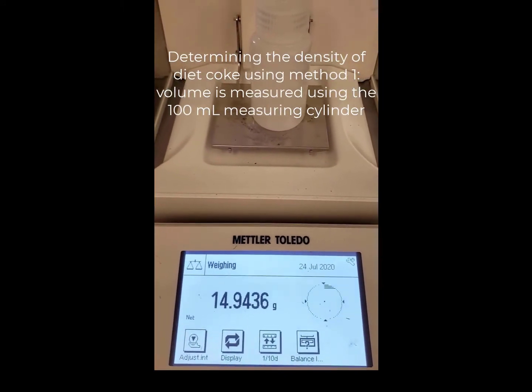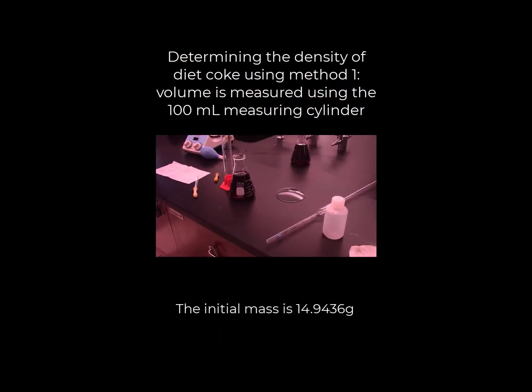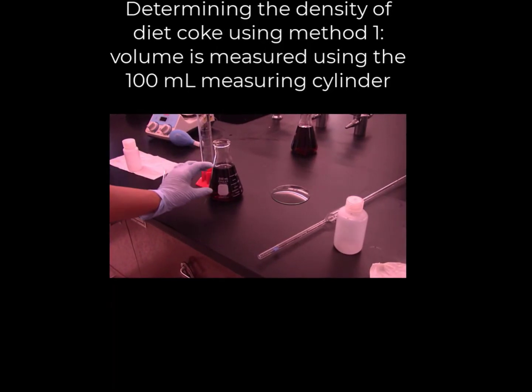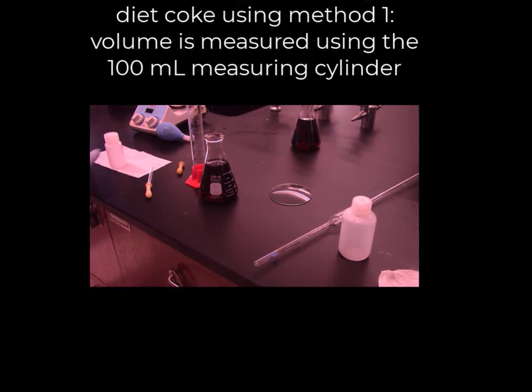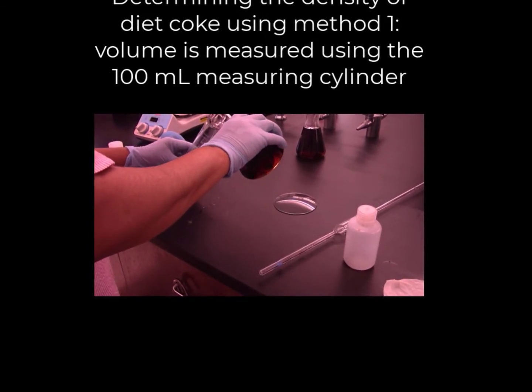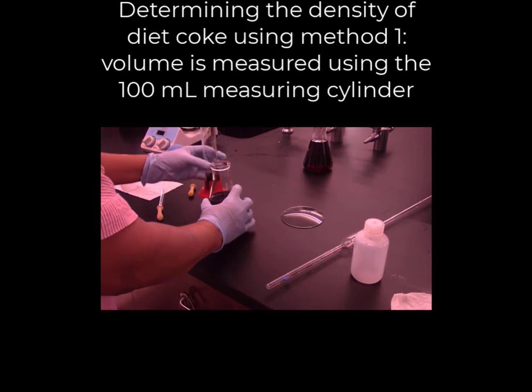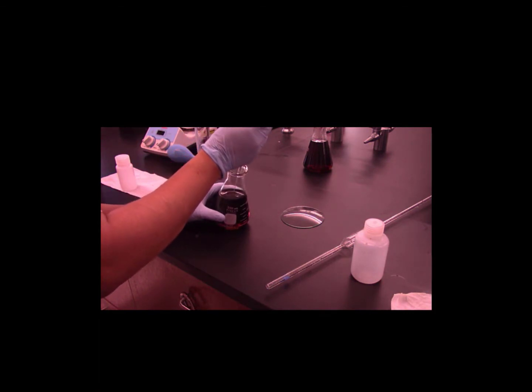This is the mass of the empty bottle, or the initial mass. We measured the mass of this white plastic bottle, and now I am going to pour 25 milliliters of this Diet Coke into this measuring cylinder, and then pour that Diet Coke into the white plastic bottle. I will try to slowly pour the Diet Coke along the side of the measuring cylinder so that I can avoid any air bubbles. It is about 20 milliliters. The rest I am going to add using this Pasteur pipette.